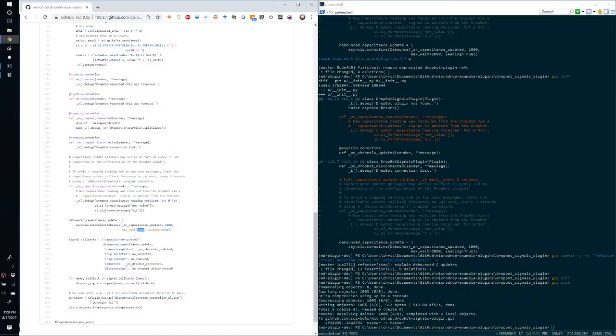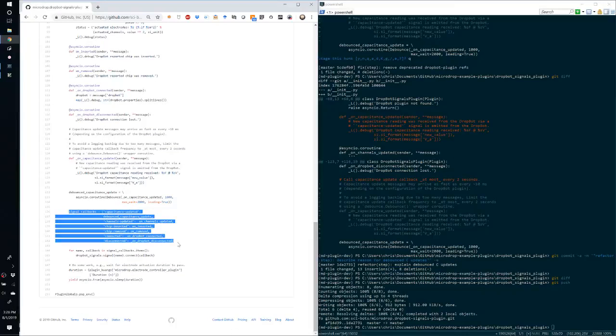And you can look at the implementation of the debounce library to get more details, but the main thing here is that you can set a maximum wait that you need to wait before you call the callback. So this allows us to not call this for every capacitance updated message, but only call it at a maximum of every 2 seconds.